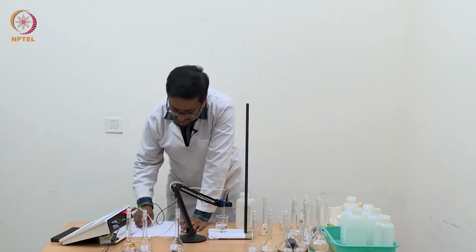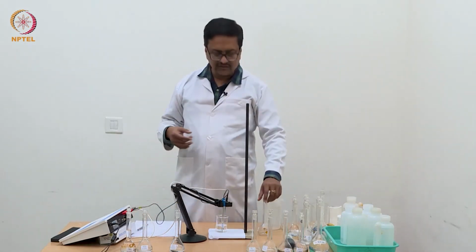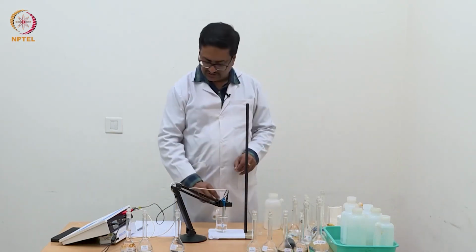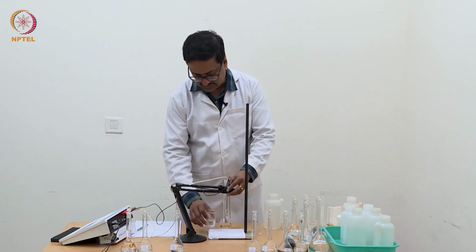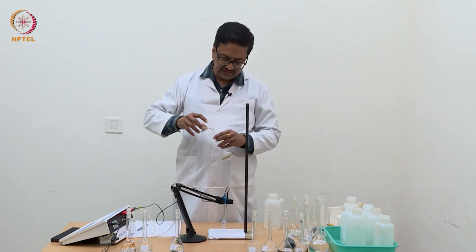Already you can notice that with increase in concentration almost every time 2 times, the conductance is not increasing 2 times, which was happening with HCl. So you can understand the reason behind it.